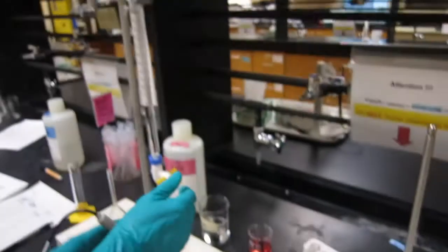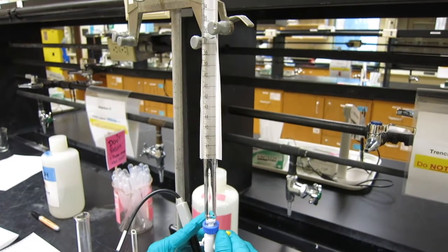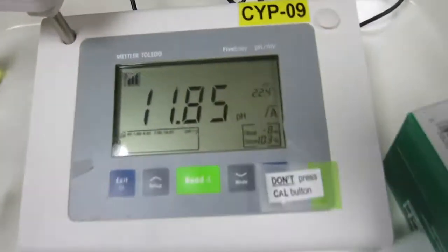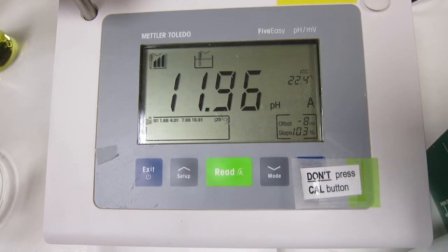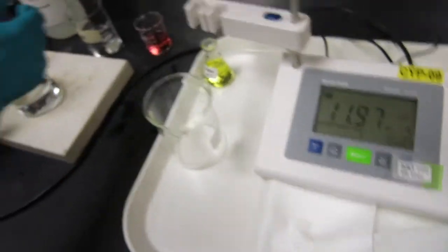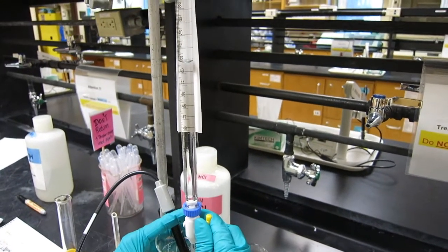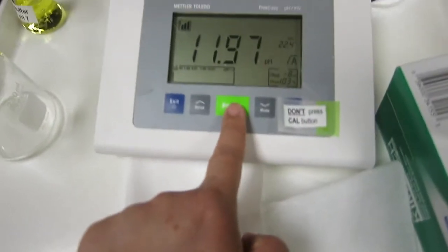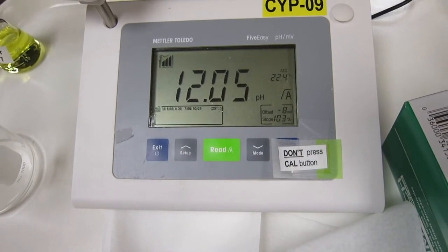Now up to 40. We dispense another 5 mL, total of 40 mL going to the beaker. Here we go, there we go. It's 11.97. That's 45. Another 5 mL. It's going to be a total of 45 going in. It's 12.05.